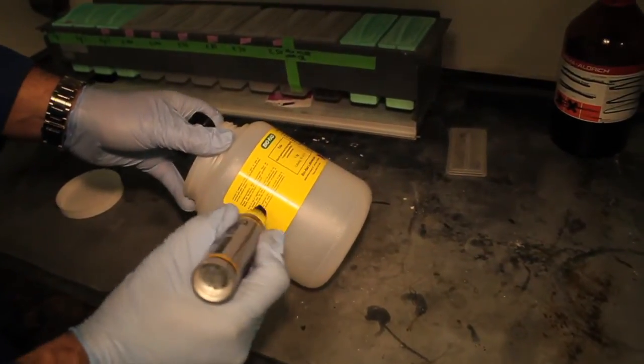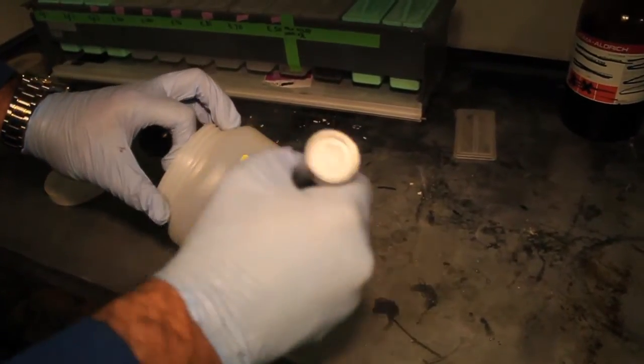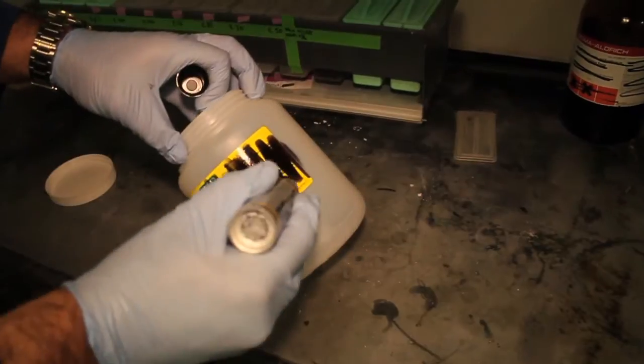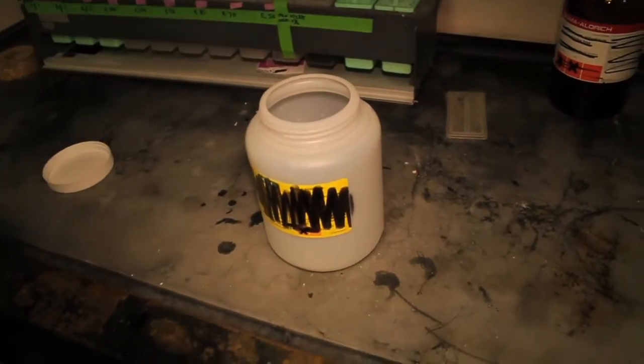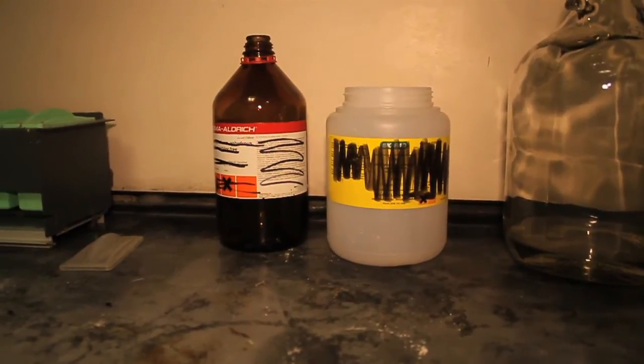You are now ready to deface the label. Make sure to completely deface the entire label. Allow the empty containers to dry in the fume hood.